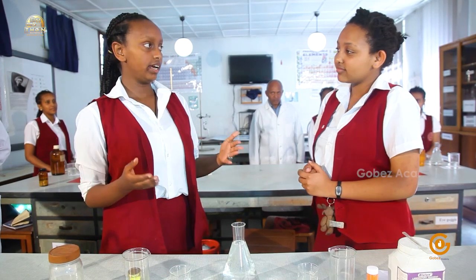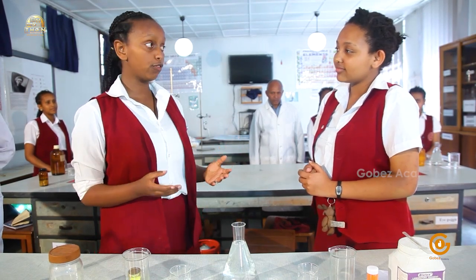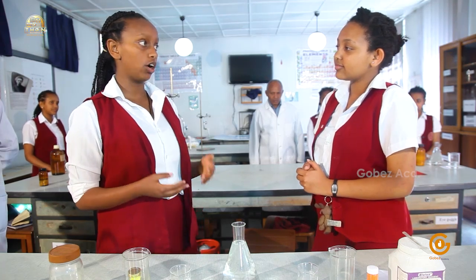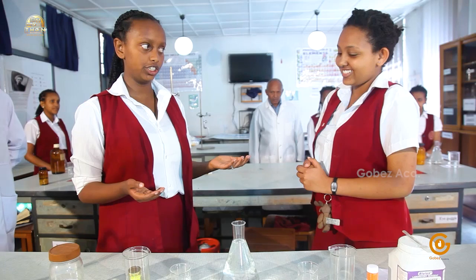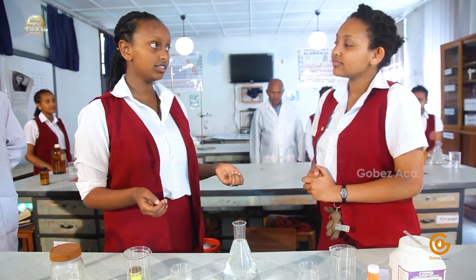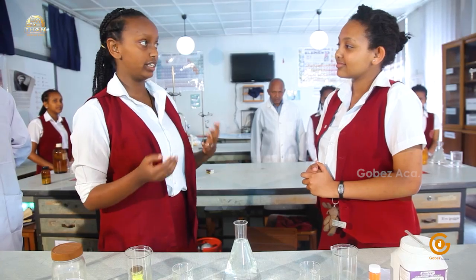So today the objective of the experiment that we're going to perform is to prove or show or confirm that chemical changes are often accompanied by color changes. Yes. So before we go right ahead to our experiments, let's prepare our chemicals and introduce you to some of our instruments, shall we?